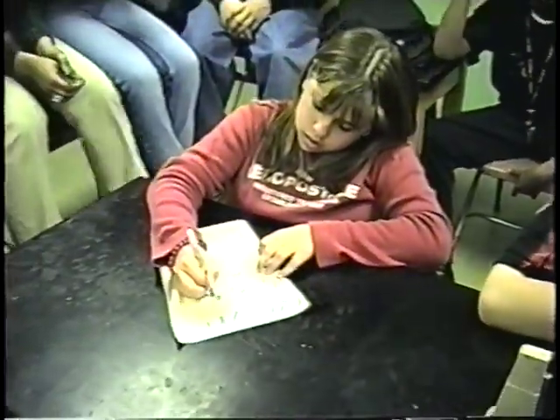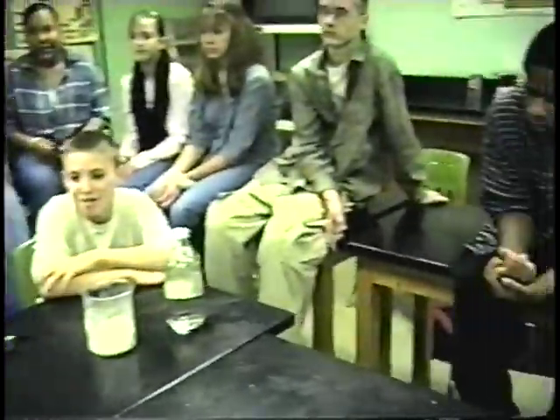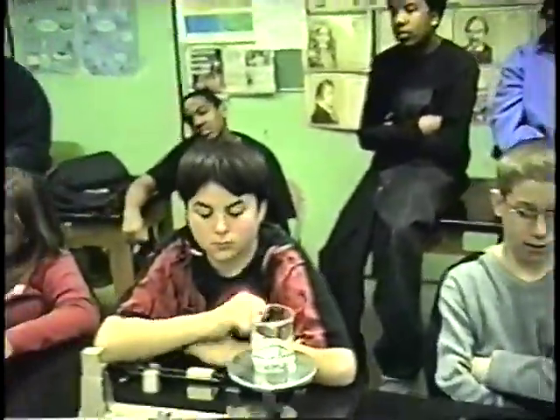57.8. Okay, now in a couple of seconds, we're going to mix it together, and we would theorize that it's going to be a certain weight if we mix it together. Mathematically, what do we have to do to get the theorized weight? Just mathematically, what has to happen? We have to add up. Yes, that's all I need to hear is add.